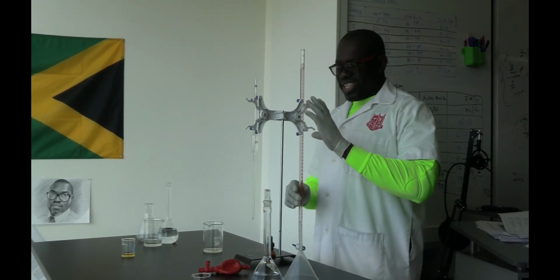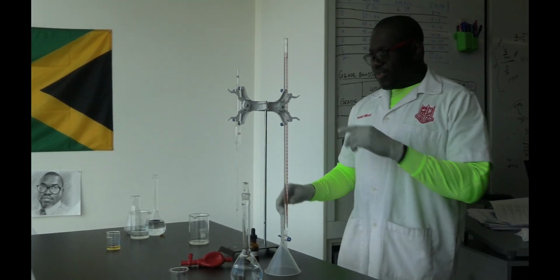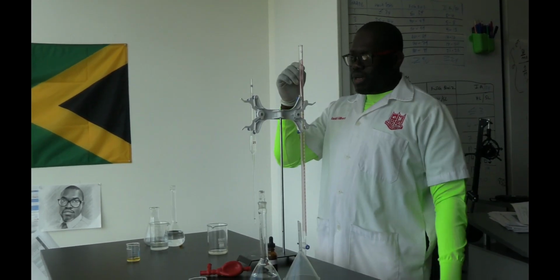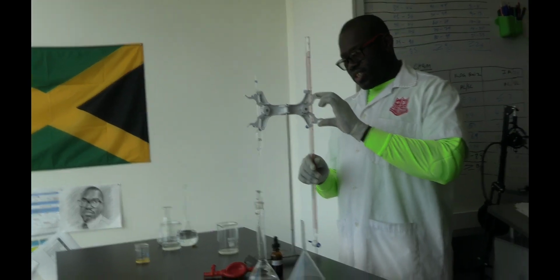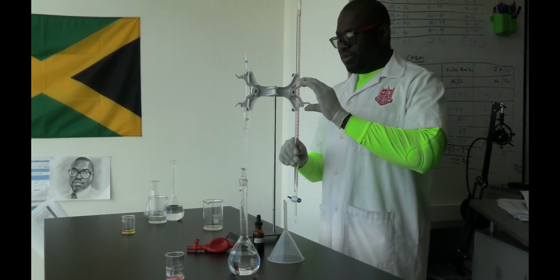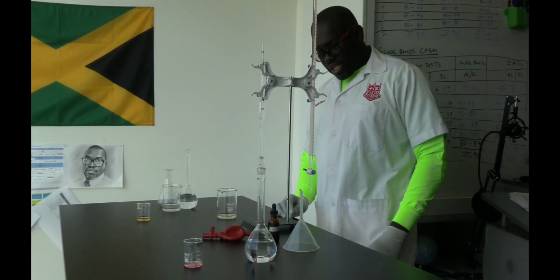And of course the burette is like a ruler which runs from 0 at the top, and this is a 50 mL burette, to 50 at the bottom there. So you can just read it just like a ruler. The increments are on it. So you take your reading, and this would be your initial reading. You record this in your table. If you do not record data, then going to a lab is not going to be very useful for you. You have to get results when you go to the lab.